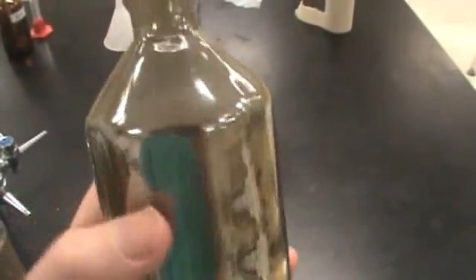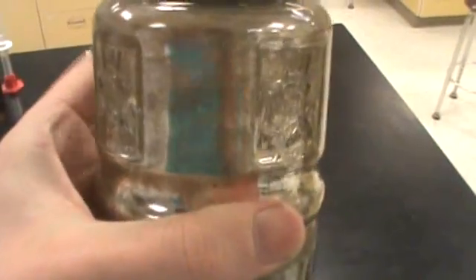So this is how you would make a silver mirror inside of a flask or something in your lab. Just get a nice little mirror on the side. And depending on what kind of glass you use, you can get some really cool designs. If you've done this on your own, you might have ended up with something that doesn't look as great, something like this. You can see through a little bit over to this other side, and it looks kind of splotchy.